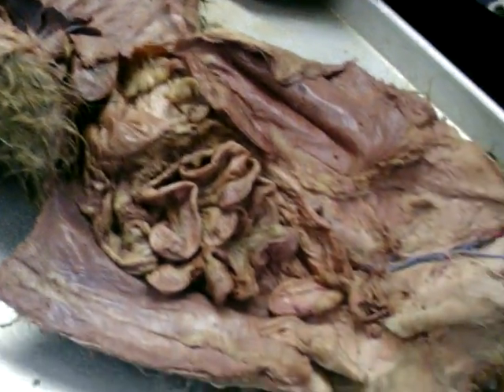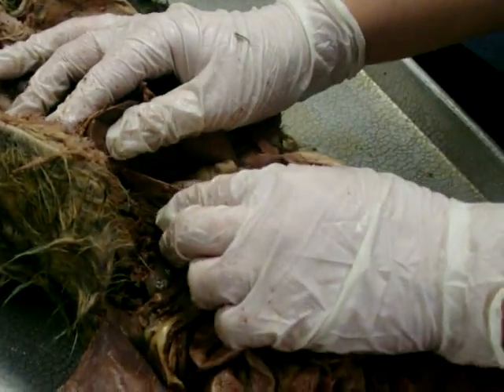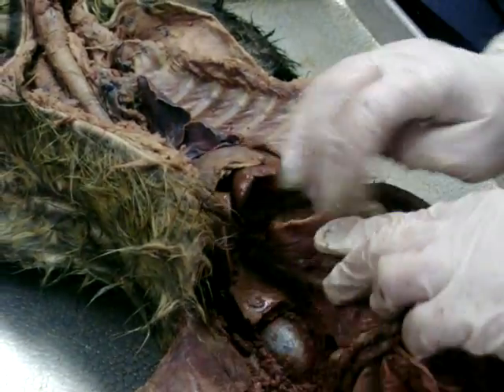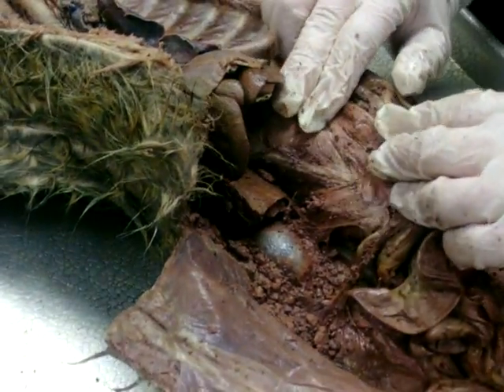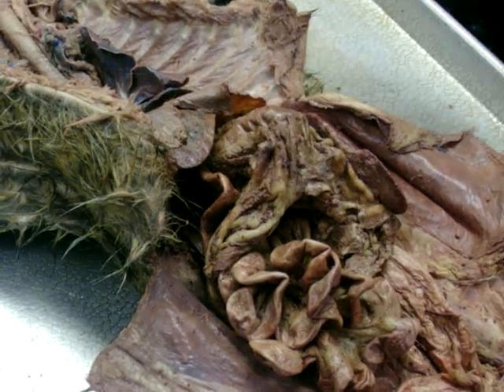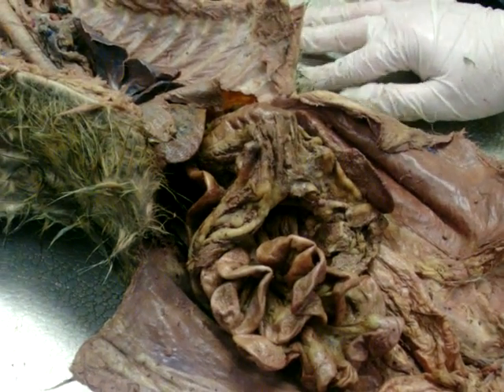Oh yeah, the hepatic bile ducts. I mean, like I said, it's hard to label. Okay. So I probably wouldn't. And you can't really see it that well in this cat because there's all this chyme in the way. But normally you have the hepatic bile duct, which leads from the gallbladder to the small intestine and the duodenum where it releases the bile. But it's such a pain to see. I would only really ask that you understand it as far as the little drawn diagram that I give you that shows the ampullae and everything where it goes into the small intestine. I don't think I could label it on the cat just because it's really hard to label.